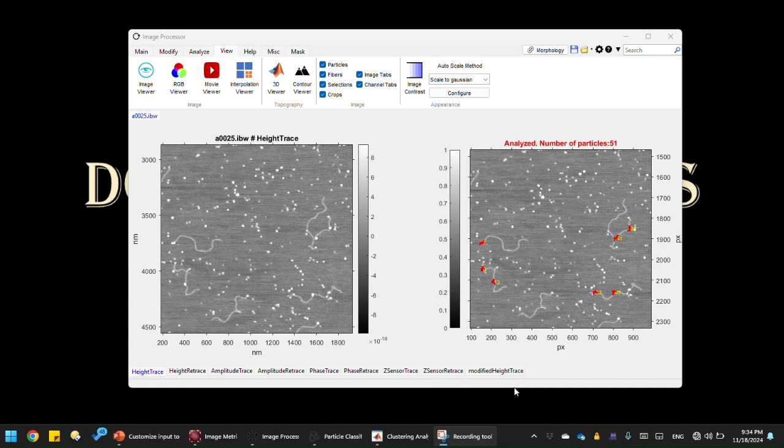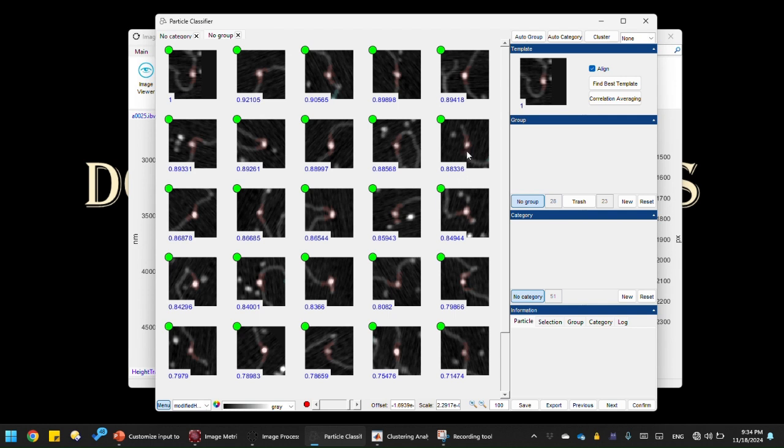I have it already open in the background, and I already threw a bunch of junk particles into the trash. So we just go directly through the classification process. As you see, the particles, the protein DNA complexes, are presented here, and you can see the mask around the protein DNA complex. So that's the data, the masked area are the data that we use for our classification and alignment purpose.